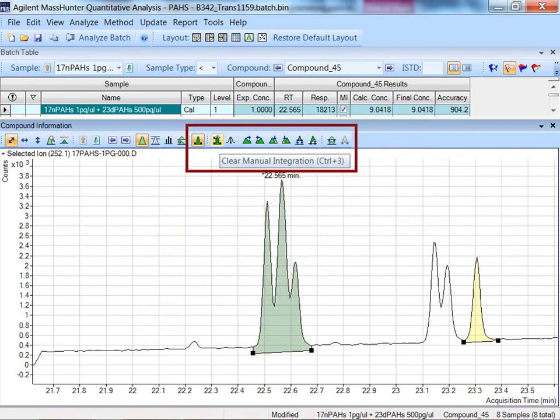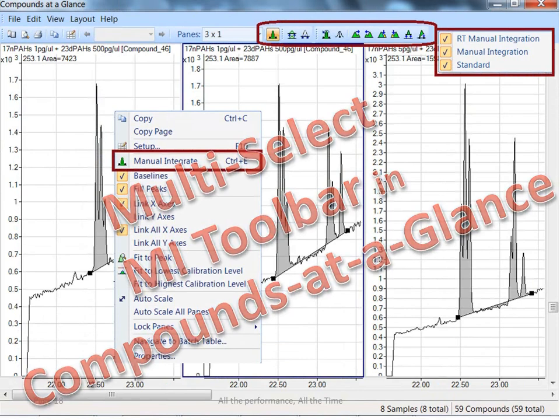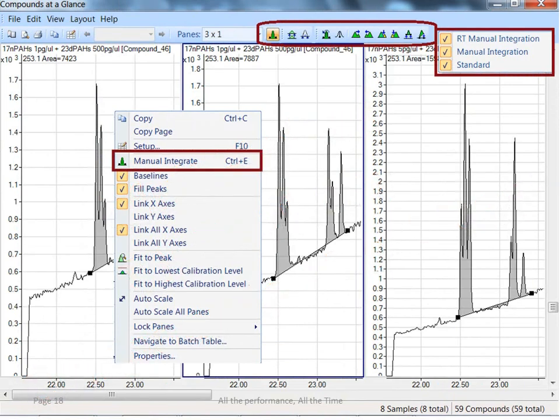So quickly, there's really two locations where the manual integration toolbar appears. First, there's batch at a glance, which allows you to manually integrate a single compound at a time, and then there's the presentation of compounds at a glance. Now, compounds at a glance amplifies the power of the manual integration toolbar. So let me repeat. In compounds at a glance, the manual integration toolbar enables multi-select. So thus, you can operate on multiple chromatograms in one click. So if you spend too much time manually integrating, you should certainly consider its applicability.